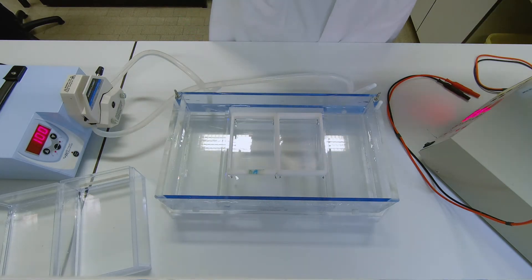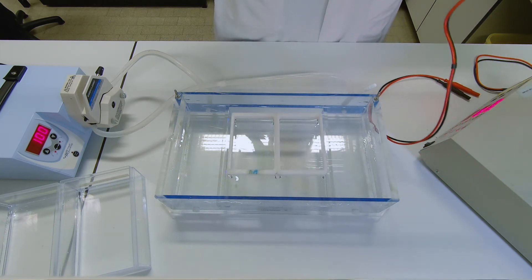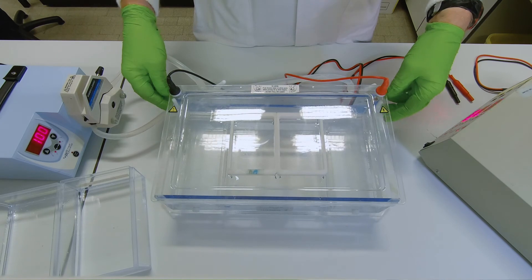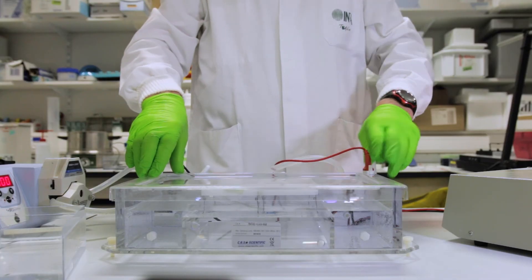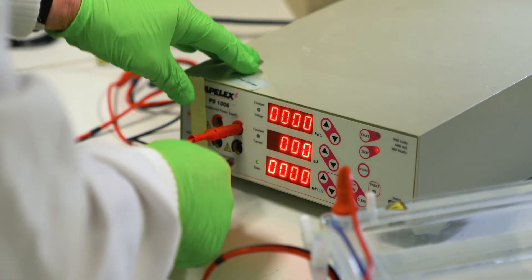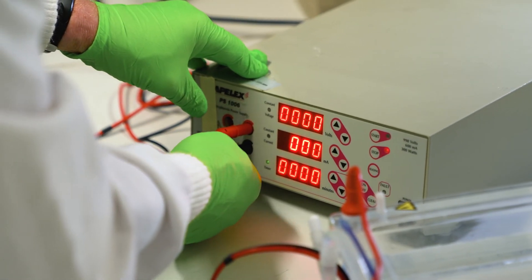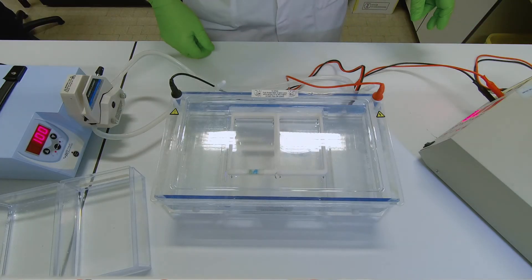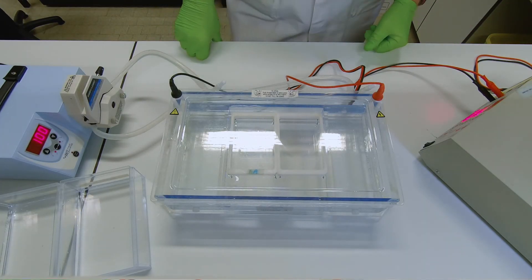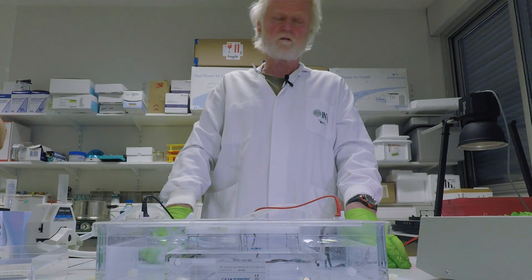So after 40 minutes I take the lid and put it on top of the electrophoresis tank to ensure that there is connection. And then I take the two leads into the power supply. Now I can start the electrophoresis because now the 40 minutes have gone. So I press start. So now we can go for coffee.